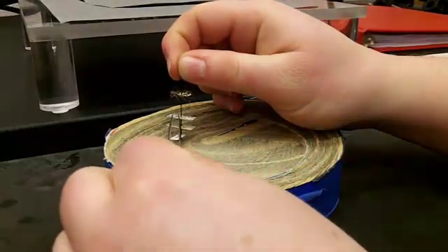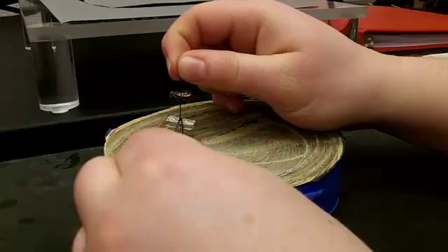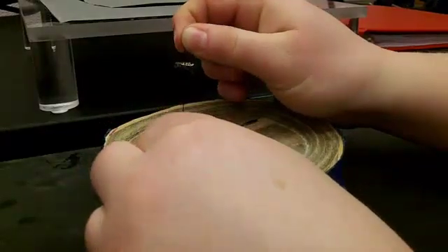So you take your tool, you squeeze above the labels and push down. Now you have removed your labels.